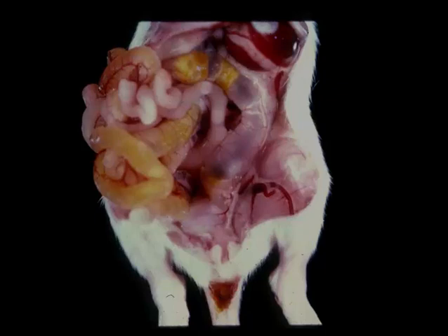and characteristically infects the cells of the apical intestine, resulting in necrosis, contraction of those villi, reepithelialization, and loss of tremendous amounts of surface absorptive and digestive areas in the intestine. So the animals develop diarrhea and cannot absorb nutrients from the milk because it targets these terminally differentiated enterocytes. The animals don't develop crypt necrosis, and they can survive rotaviral infection.